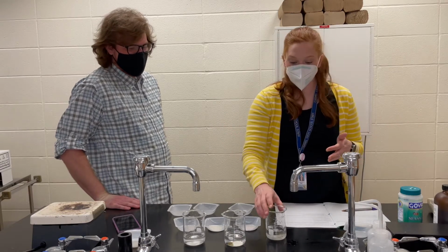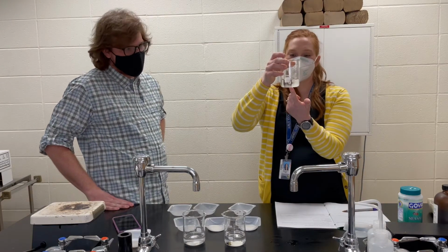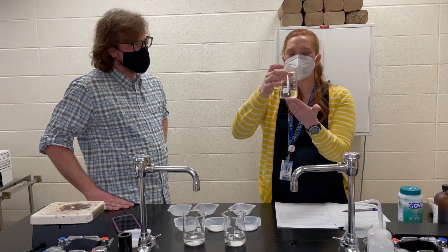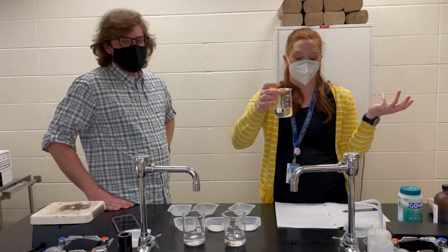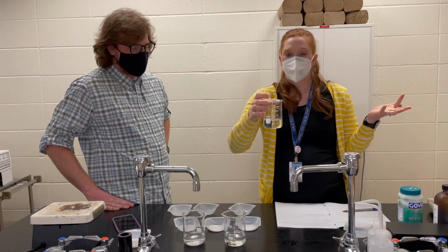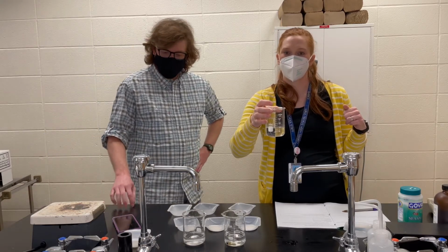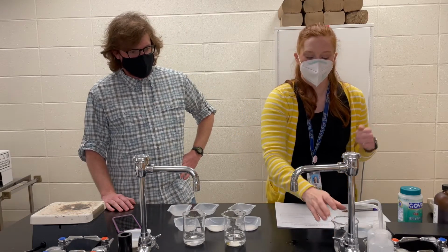So we've got a beaker here that is my no stirring room temperature beaker. And this guy took us 8 minutes and 27 seconds to dissolve all of that salt just hanging out. So compared to our 1 minute and 31 seconds with our stirring. So that gives you a little bit of data there to use for your claim, evidence, reasoning with the effect of stirring or agitation on solubility rate.